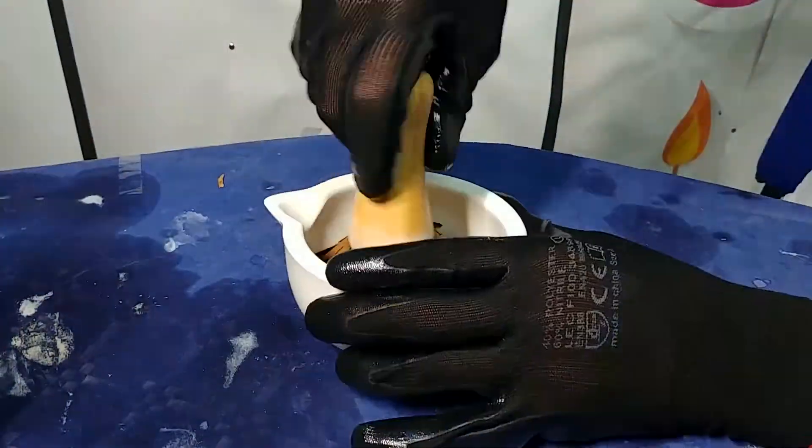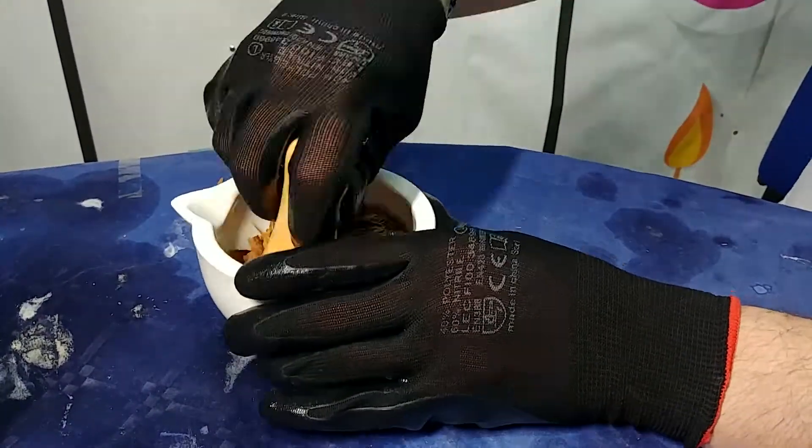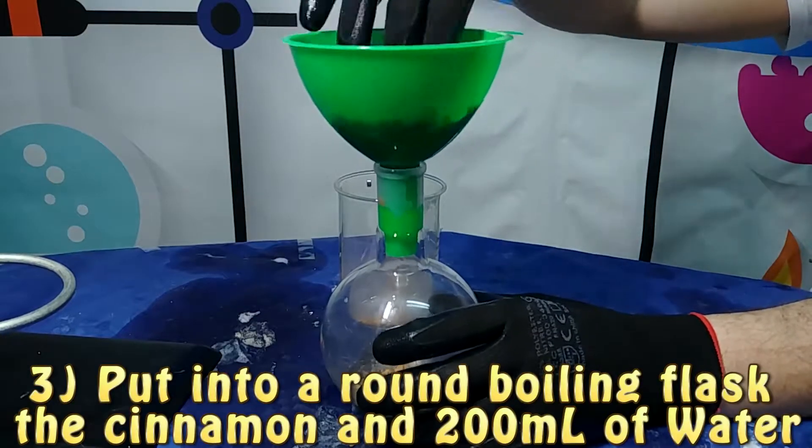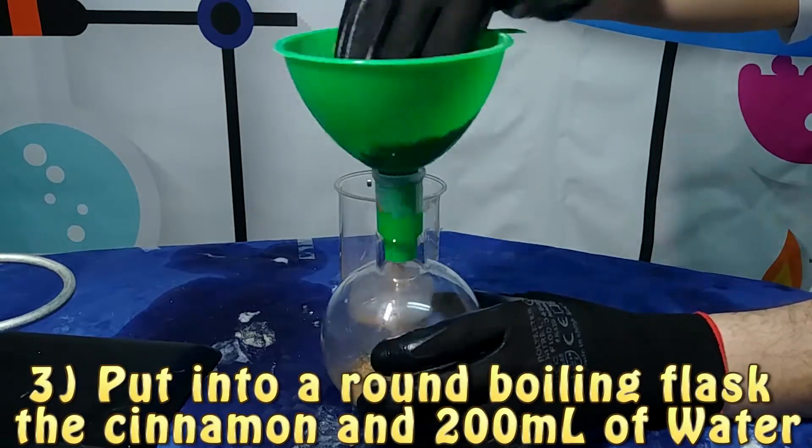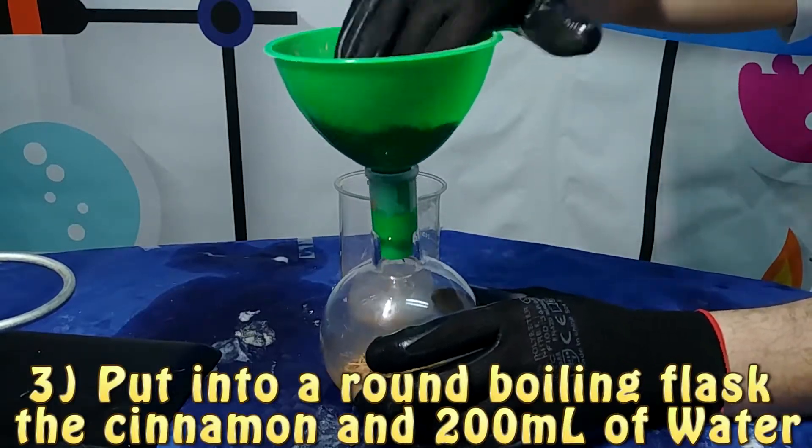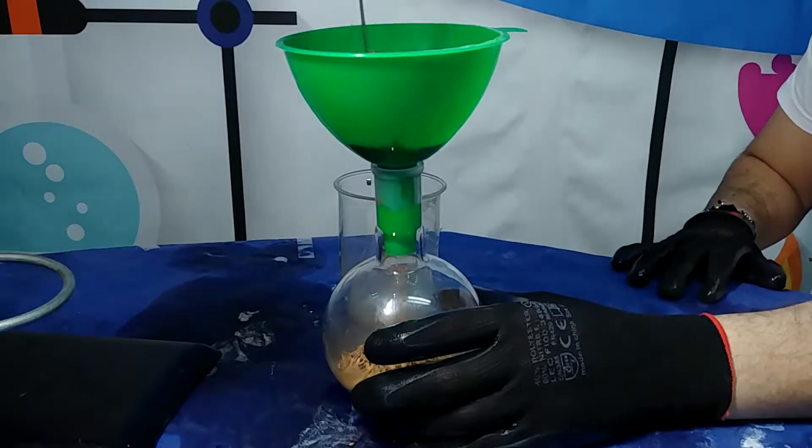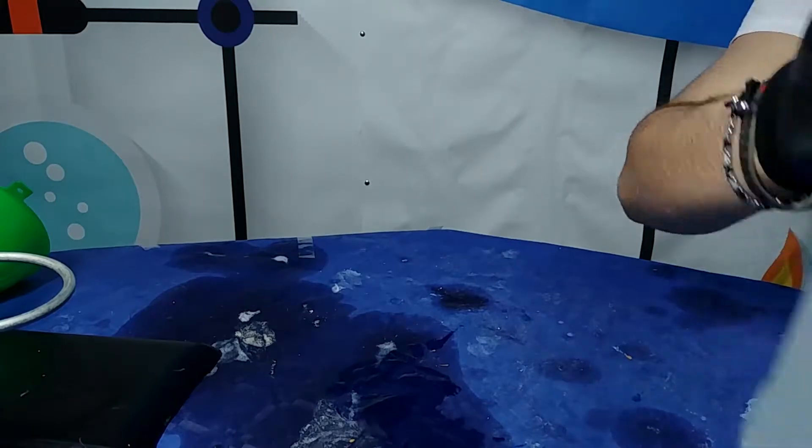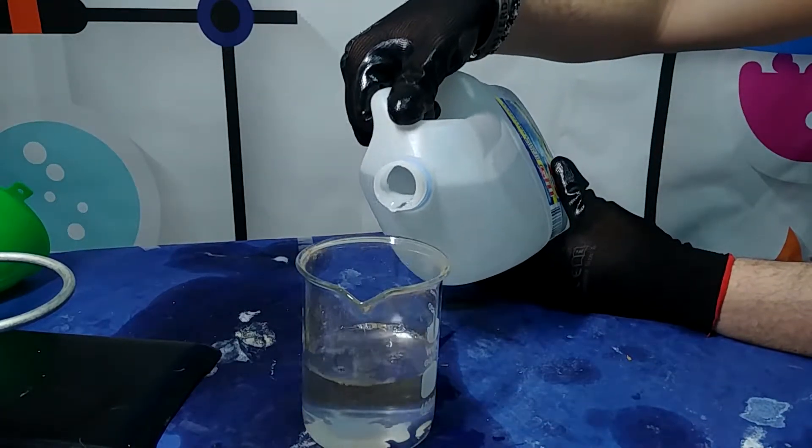We want to crush cinnamon because we want to increase the surface area. Also we want to remember that this crushing must not be overdone because we don't want to obtain a powderized cinnamon because it can form too much foam when we distillate it.